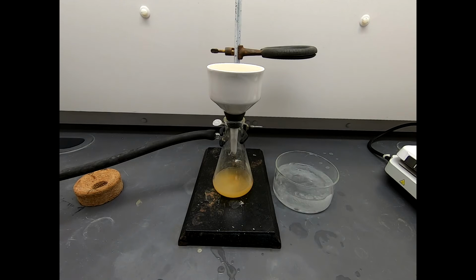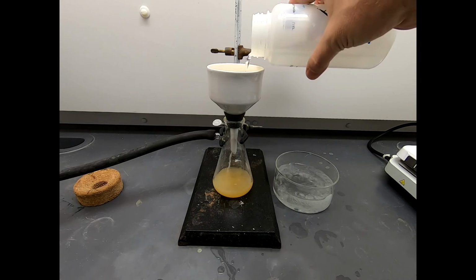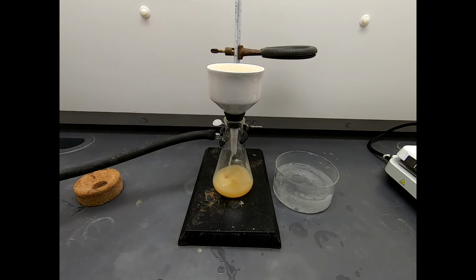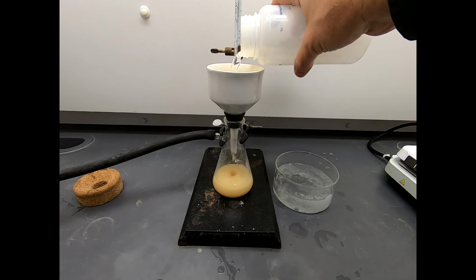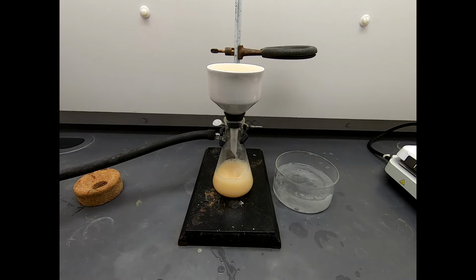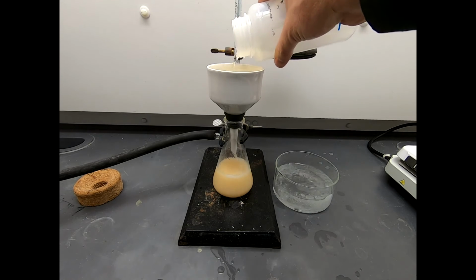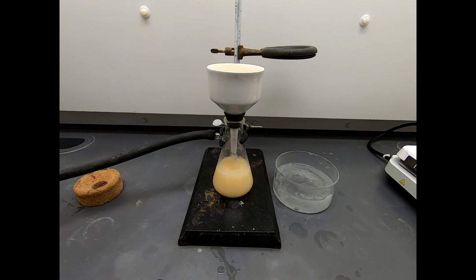Now I'm going to rinse this filter cake. We have plenty of base in there, so let's try to rinse that off. And benzaldehyde does have a low level of water solubility. So we'll use water to rinse out any excess base and hopefully to remove any benzaldehyde. You see there's some cloudiness there in the bottom. That's not a huge surprise. There could be some partial reaction products that are filtering through and are not completely water soluble.